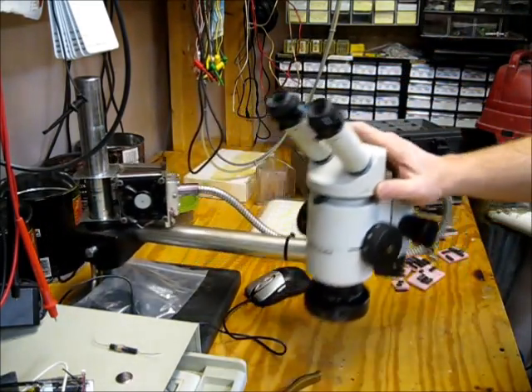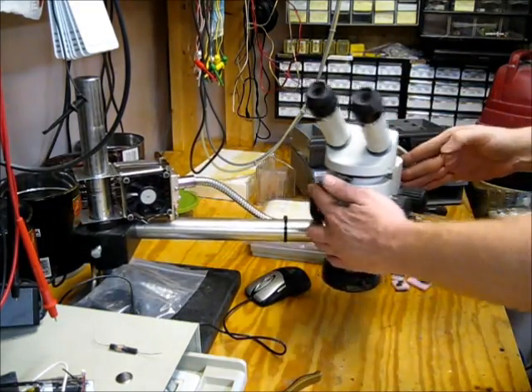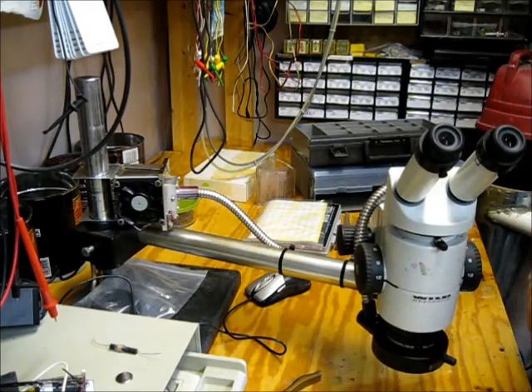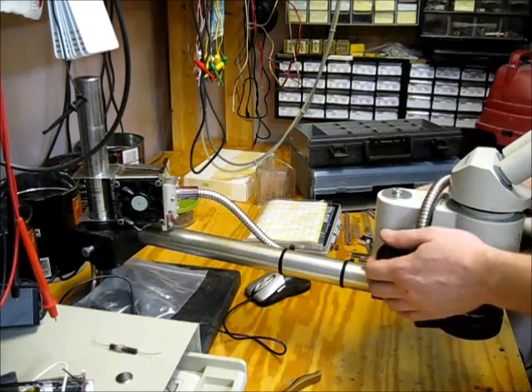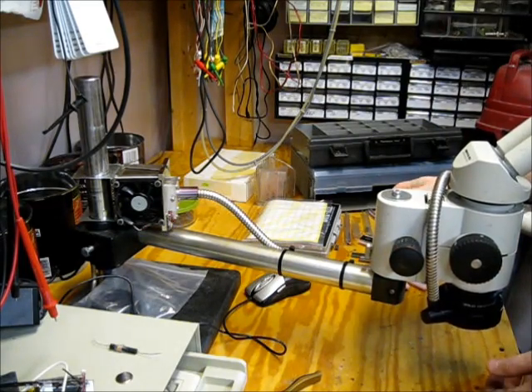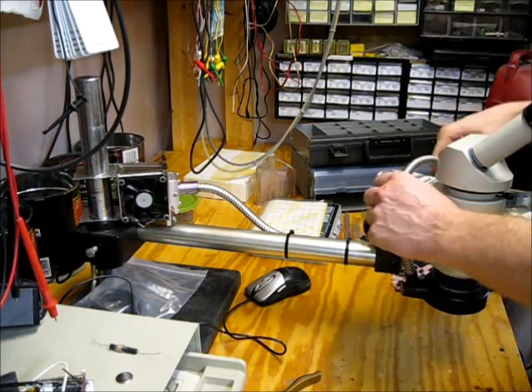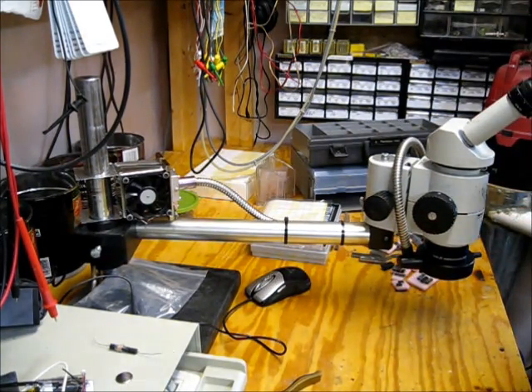So as you can see, the light source just sort of goes for a ride with the scope, and there's plenty of whip here that I can articulate the end without kinking the fiber. When in this position, I can access the focus knob pretty easily. So, yeah, it's a little goofy and floppy, but works good for my application.